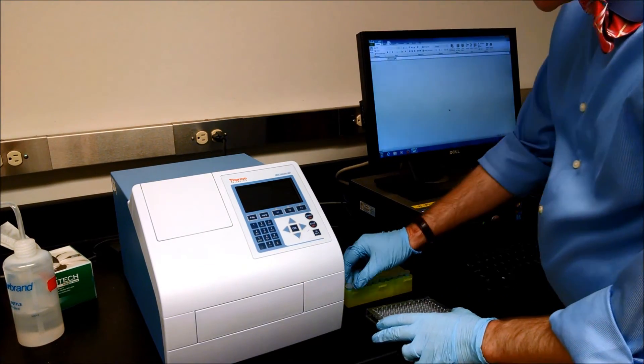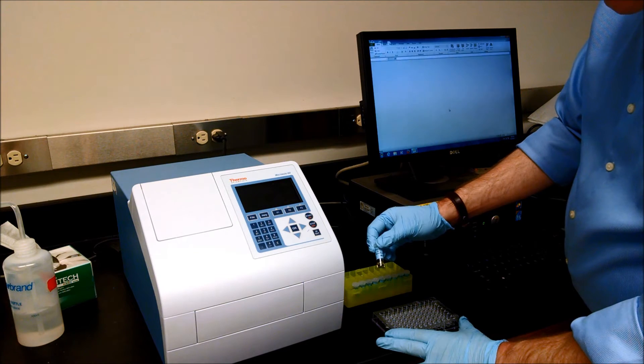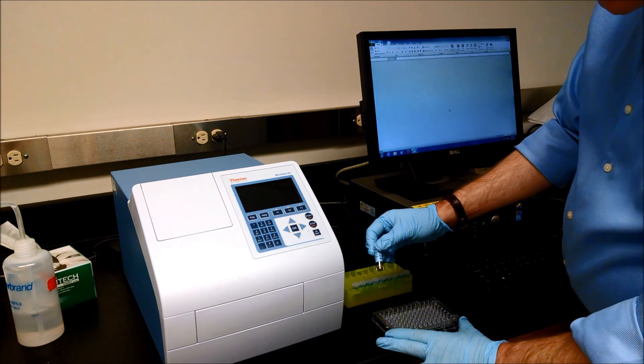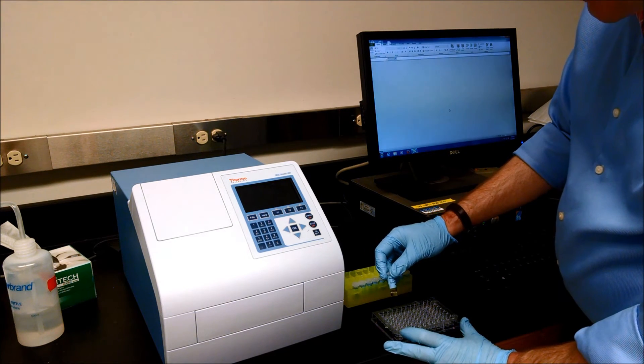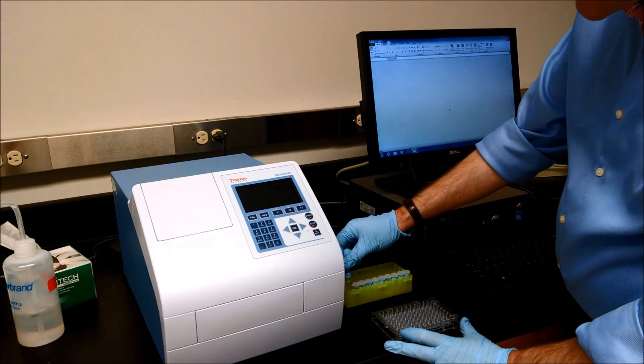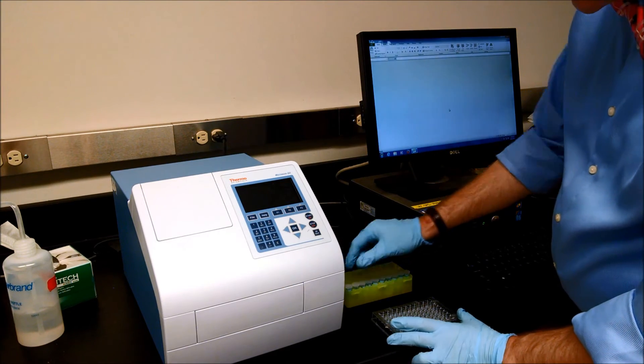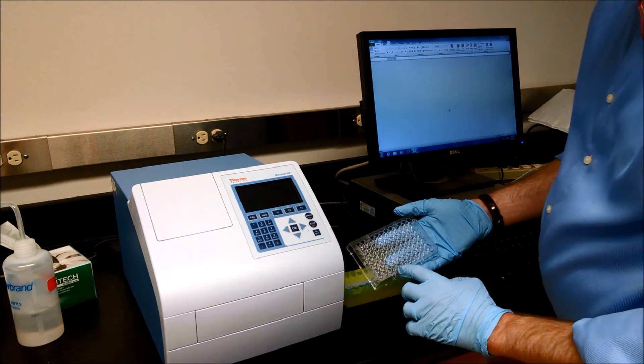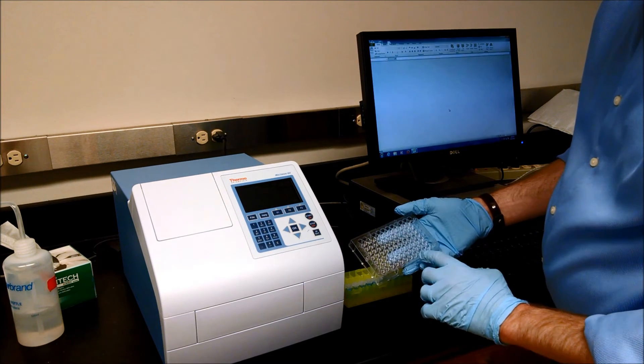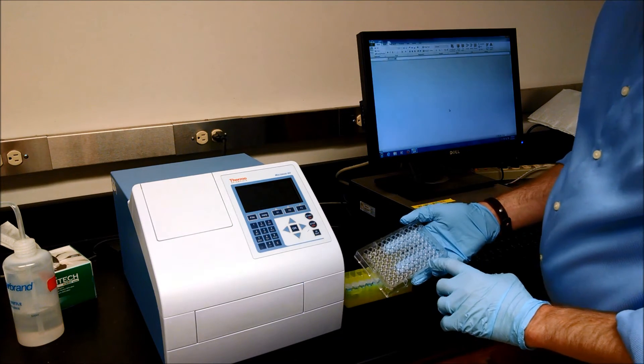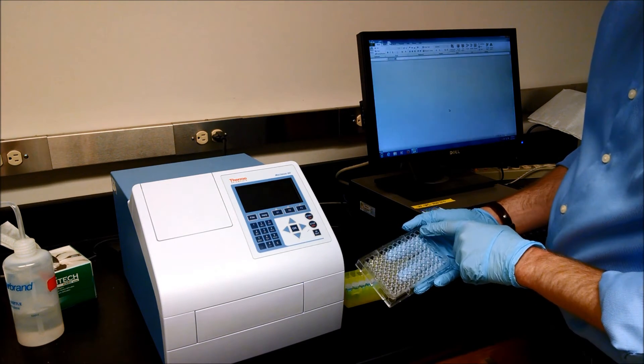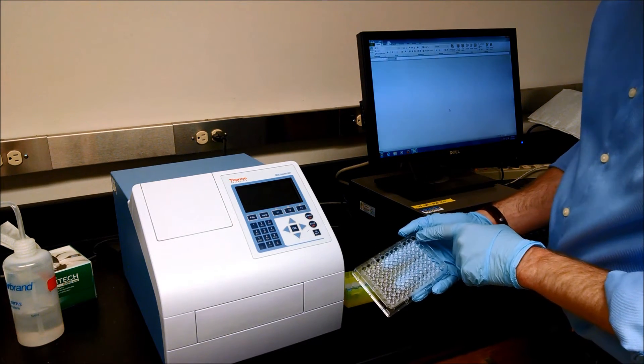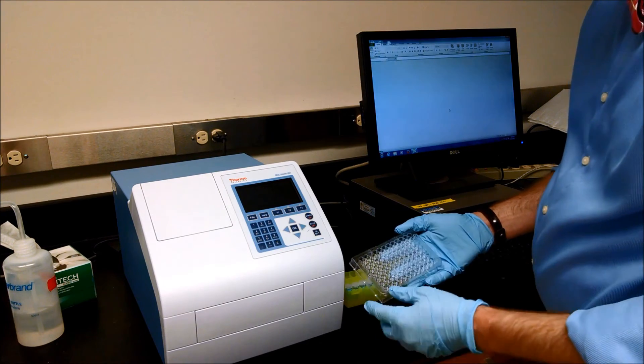And again, use a pipette to transfer your solution into the wells, keeping track of which sample goes in which well. I suggest that you select a row and use that. Also, select a well to put just the solvent to serve as a blank.